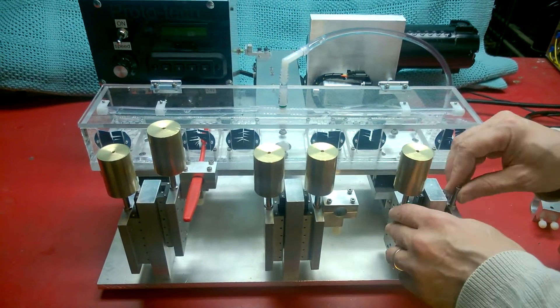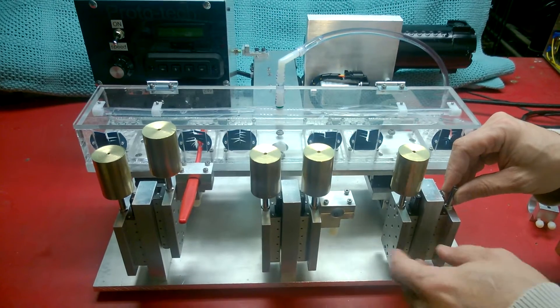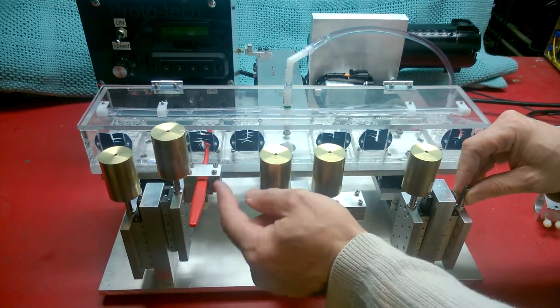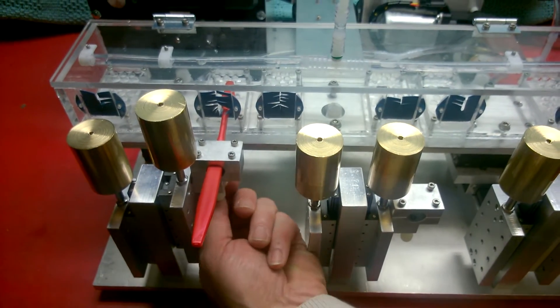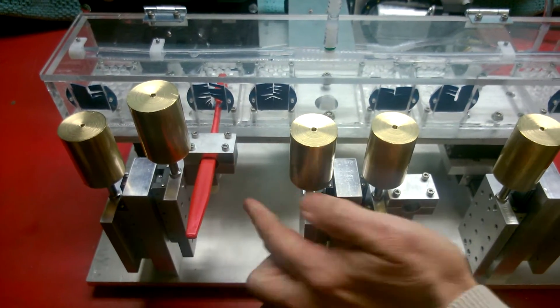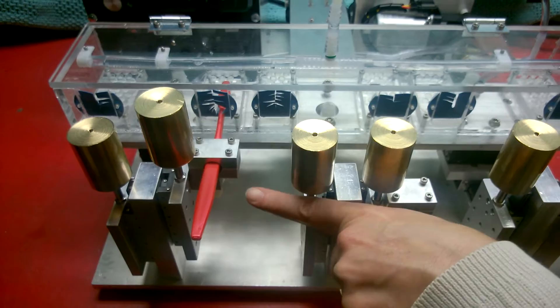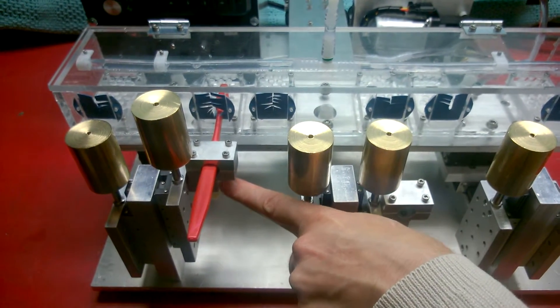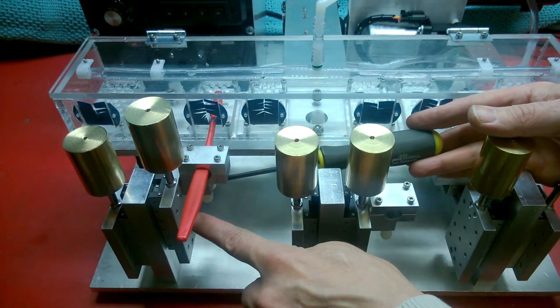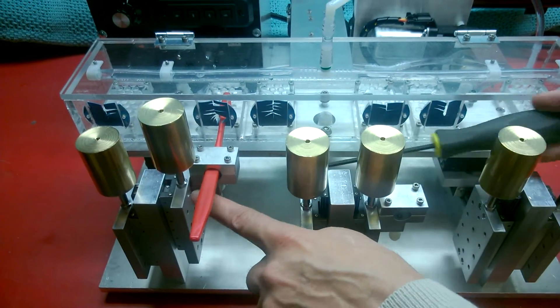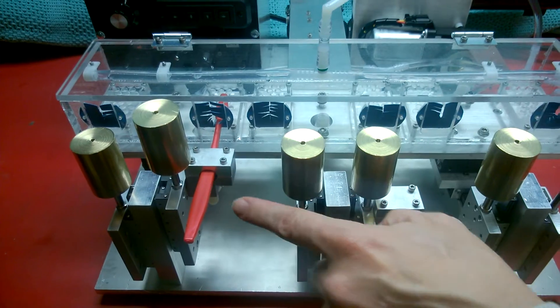We're going to show you how the toothbrushes are mounted in the machine. You can see how this manual brush is in a clamp. There's nylon screws underneath. It's tied to this plate through a hex head screw that can be reached from the side, and it can mate to a variety of holes on this plate depending upon the shape of your brush.